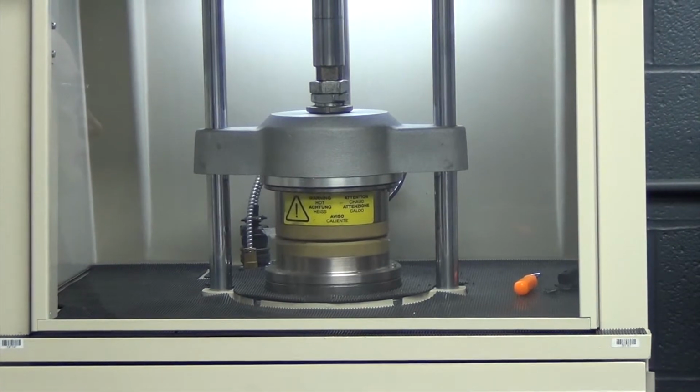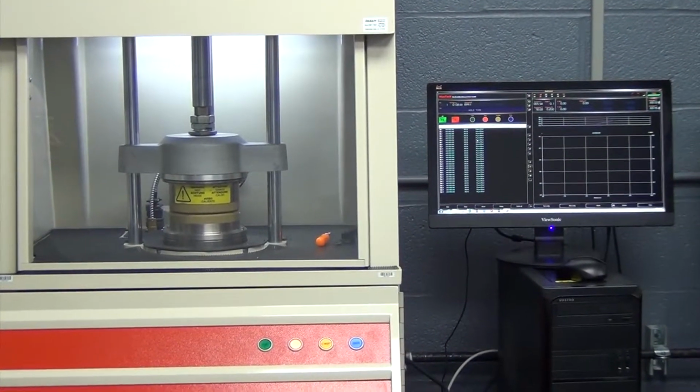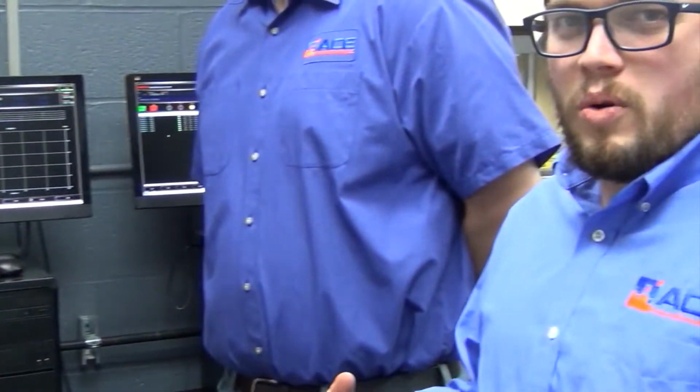But it also does process analysis, where you can simulate a lot more and put a lot more data points inside of it and create some correlation to your end process that can be specific to each individual customer. Some of the things are becoming more and more known, one of those being the Payne effect, which the tire industry has really jumped on to because of the interaction with fillers, silica being one of those, and the big push in the tire market for that. So that's one of the big things that's pushed on the RPA side, the expansion of being able to pick up more in-depth information for applications like that.